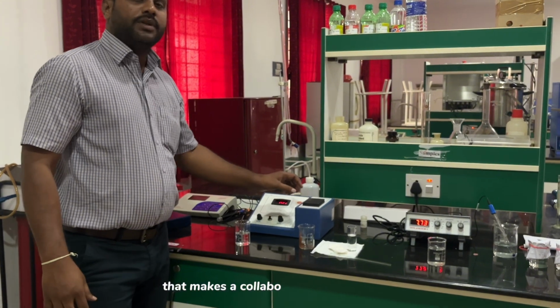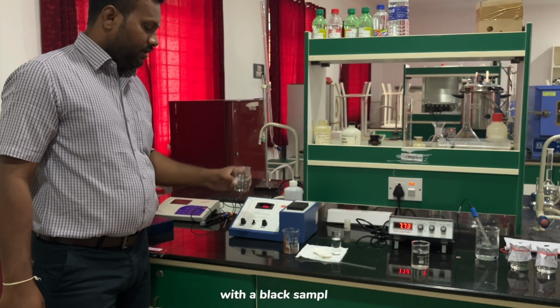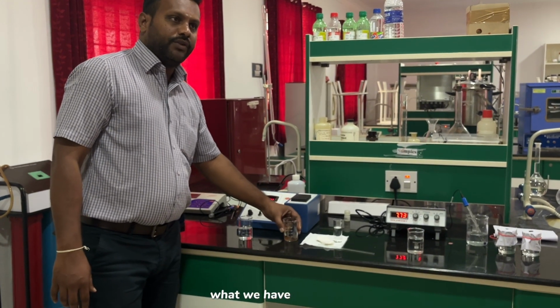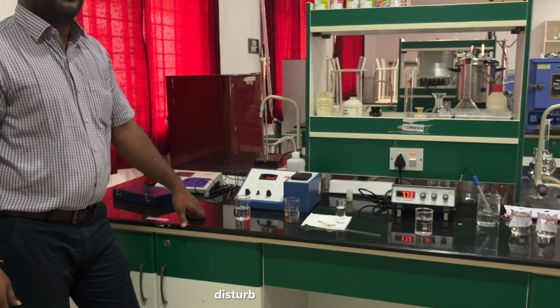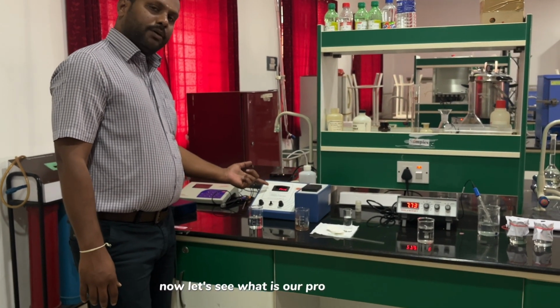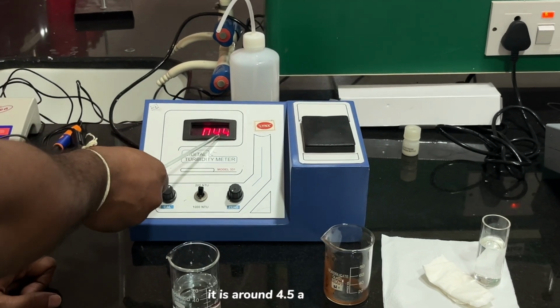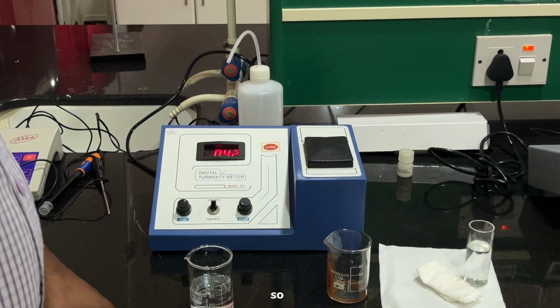Let us make a calibration with a blank sample, and after setting the instrument to 0, you can insert the sample you have, and identify the turbidity of the water in NTU. Now let's see what our turbidity in the water is. You can see the instrument shows around 4.5 NTU. Okay, 4.5 NTU. Right.